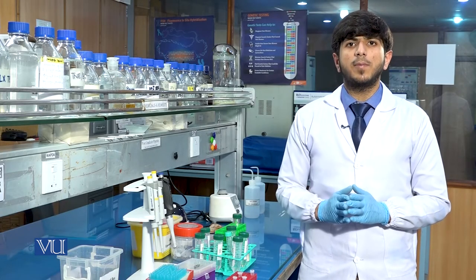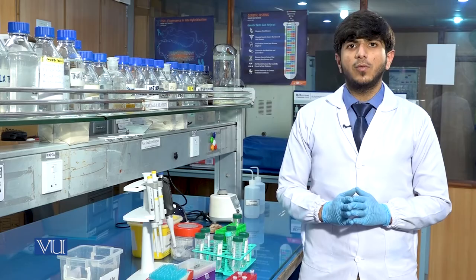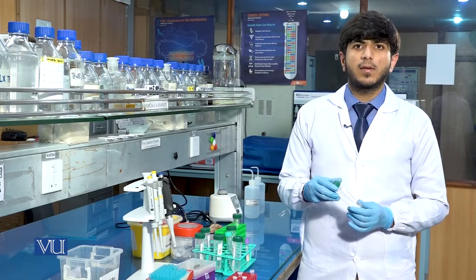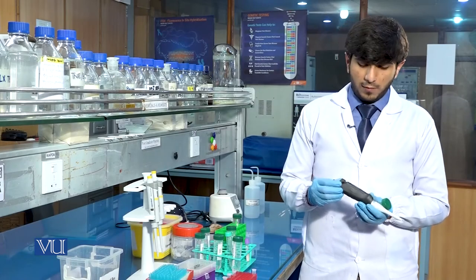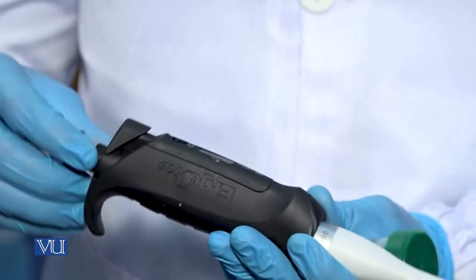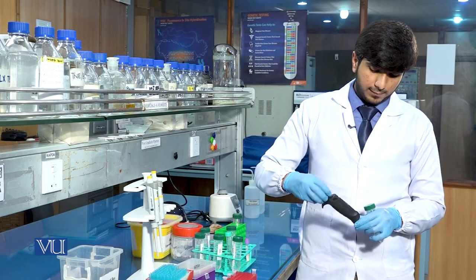The volume of the upper aqueous phase was 500 microliters, so we will add 500 microliters of isopropanol to the sample. We will take a pipette with a range of 100–1000 microliters and set it at 500 microliters.